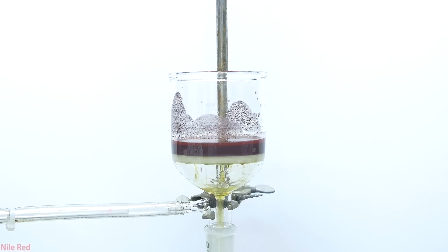I use the glass fritted filter here so you guys can easily see what's going on, but be aware that this did kill my filter. Filtering things like carbon or red phosphorus through a glass fritted filter is a terrible idea, and you'll probably never be able to clean it properly.